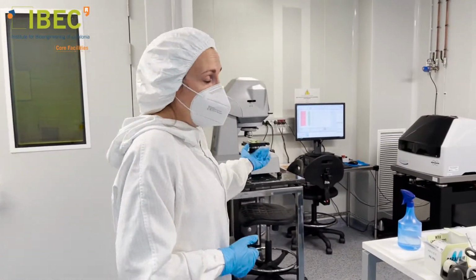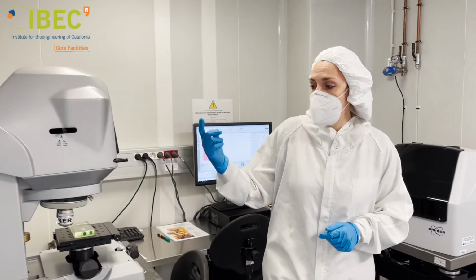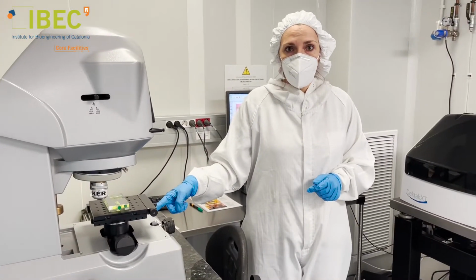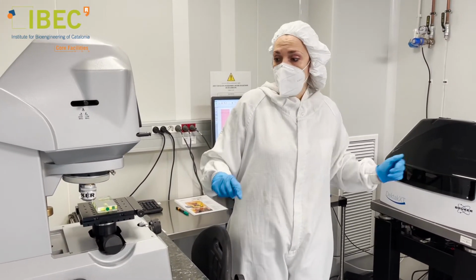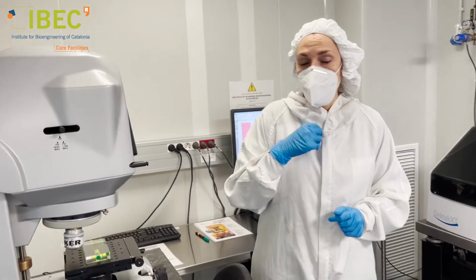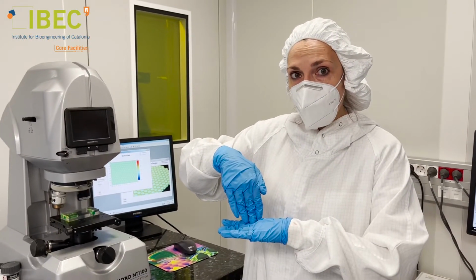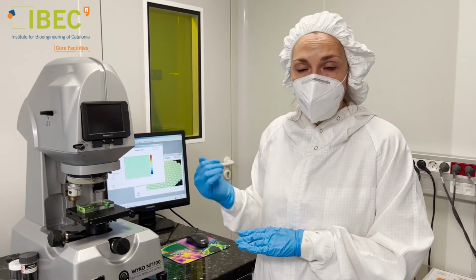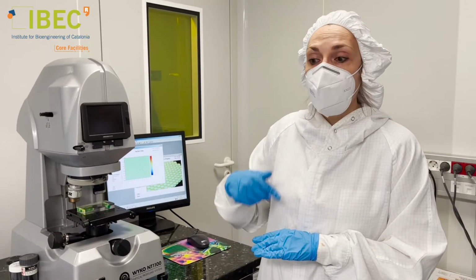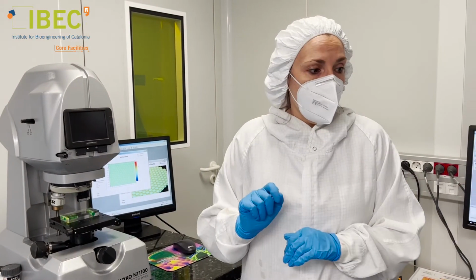And in this area, we have a profilometer. This is a light profilometer, optical, and this is mechanical. In the light one, we use the interference created by the light that is incident on our substrate and the reflected one. That creates an interference that depends on the topography that we have on our substrate.